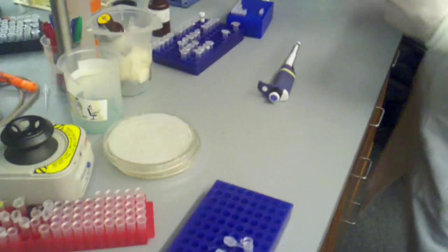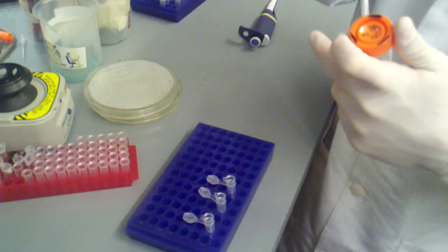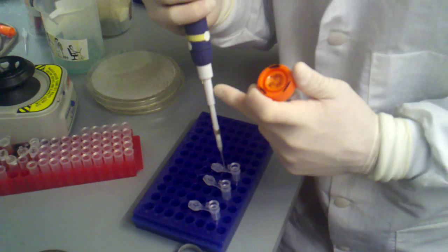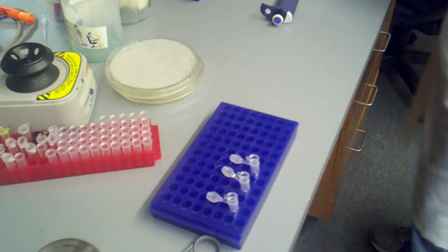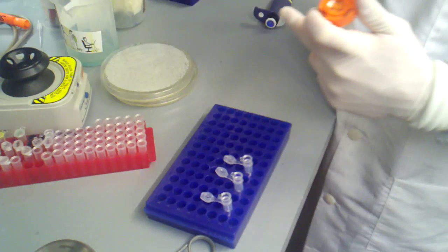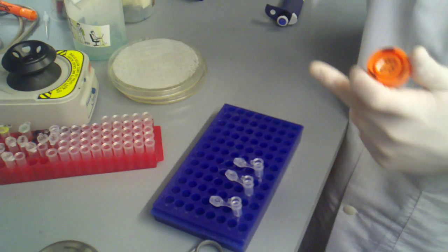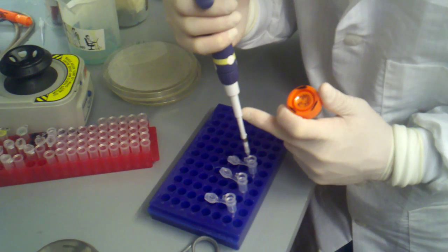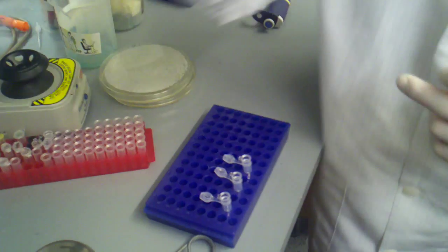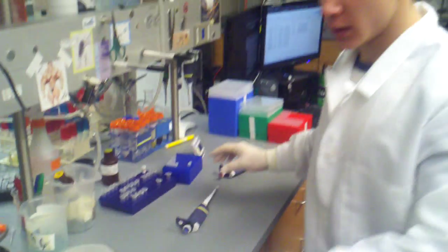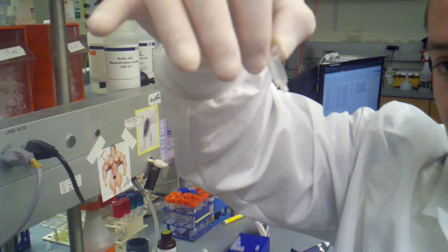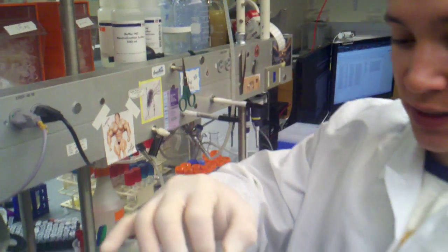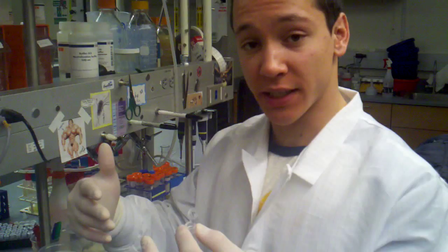And I'm actually going to be very careful. And I'm going to load that water right onto my column. You don't always have to be so careful with that. But this is kind of an important step for me. So I don't want to have any mistakes here. Sample number two. And this is the elution step. Again, normally I would be using 50 microliters at this step. But I need to concentrate my DNA. So I'm doing 17 microliters. That's it. So now we have just a little bit of water that's soaked into that white part. And you can't even see it. There's so little water in there. And it's right now, it's dissolving all of the DNA that's stuck to that bed.